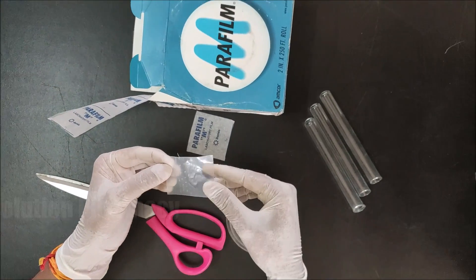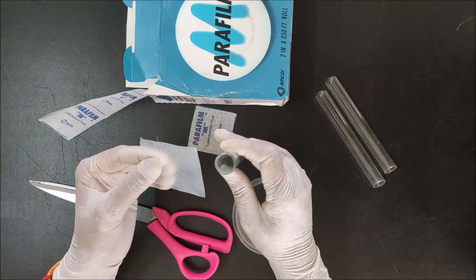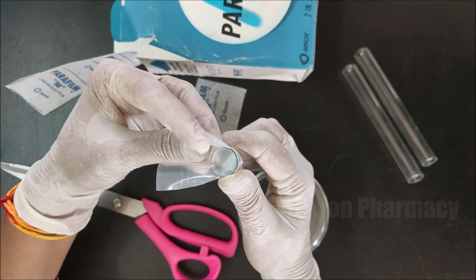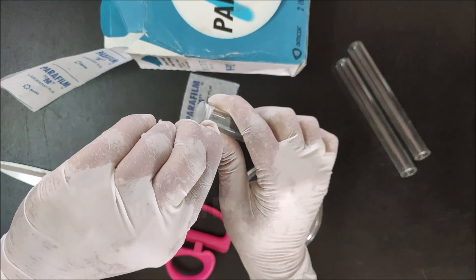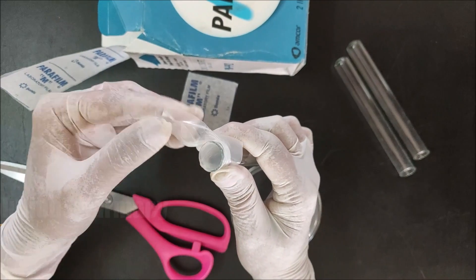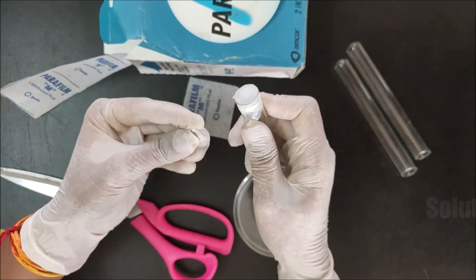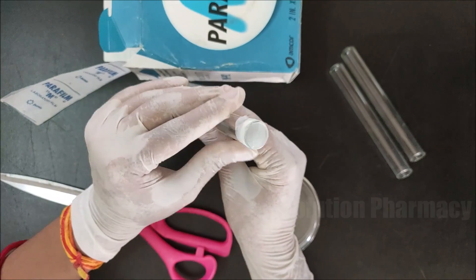After cutting the small portion of parafilm, remove the paper cover. Take a test tube, and by your thumb press one corner of the strip on the edges of the opening of the test tube. Then stretch the parafilm strip to cover the top opening of the test tube. Twist, stretch, and rotate the remaining part of the strip around the edges of the test tube, then remove any extra part of the parafilm left over.